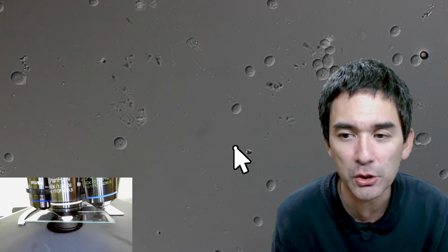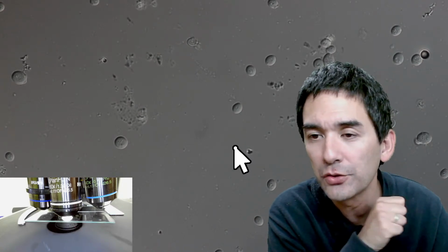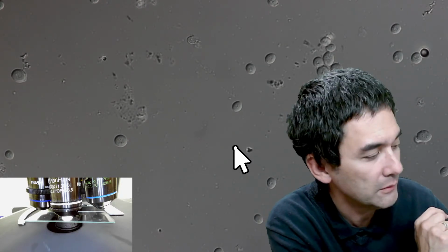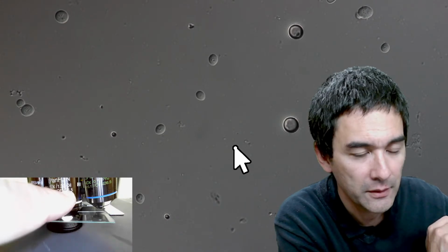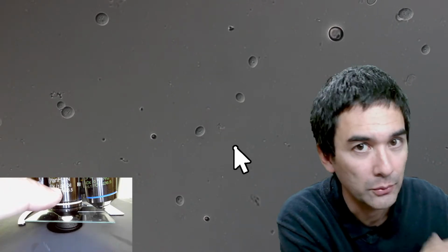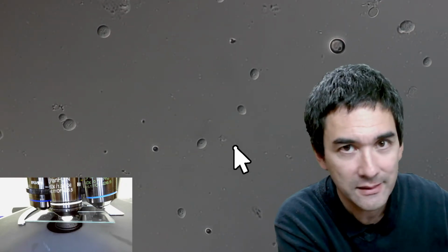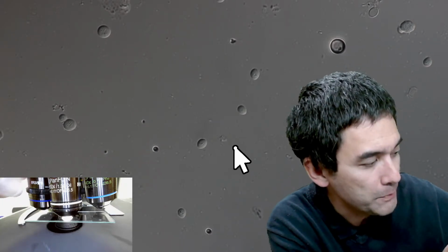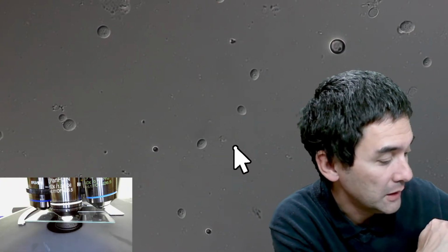In order to summarize this, especially for those of you who join in maybe a little bit later, and there's also a comment I want to make concerning the magnification later on: be careful that you do not contaminate objectives with oil. Use immersion oil only on the oil objective, which has the word oil printed on it. I've received questions from some beginners some time ago who wanted to improve the quality of the image, and they tried to use immersion oil on all of them. That's dangerous. Don't do that. Once you've got immersion oil on here, do not switch back to the lower magnification, because otherwise you're going to contaminate those as well.